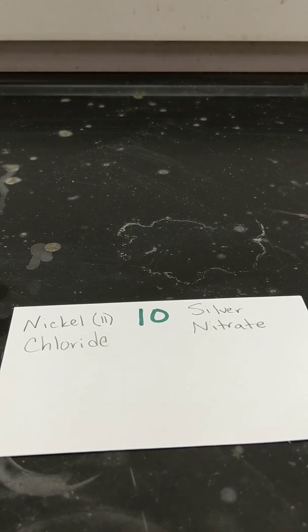Reaction 10, nickel chloride and silver nitrate.